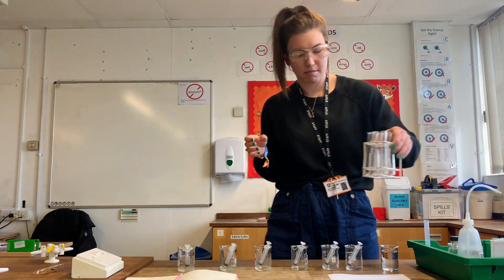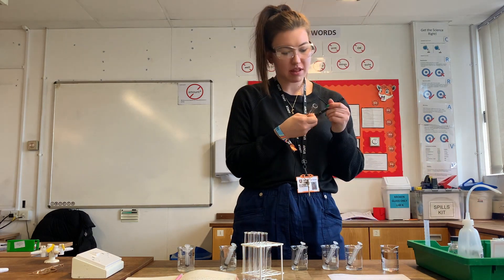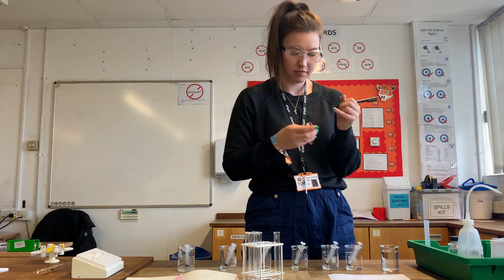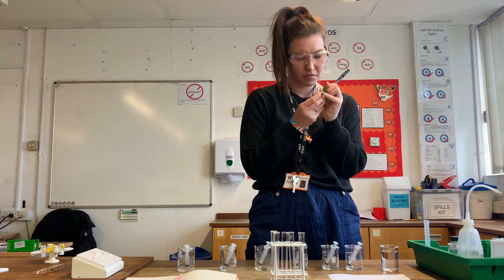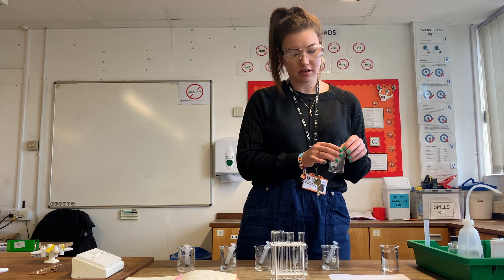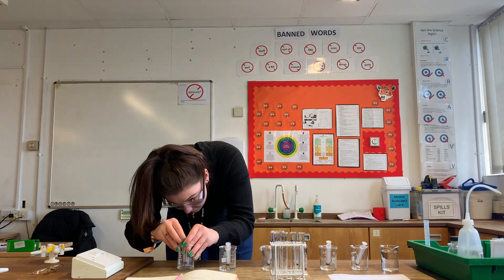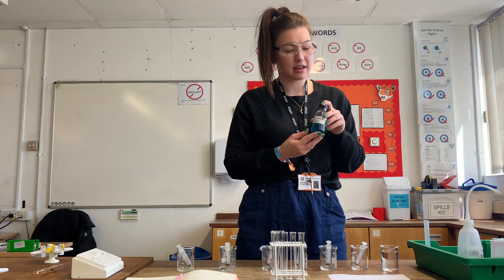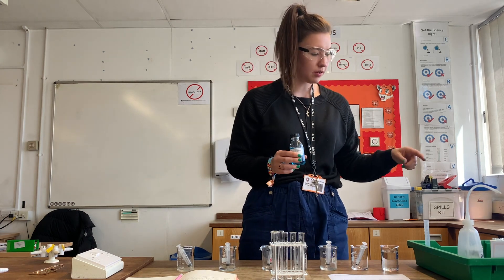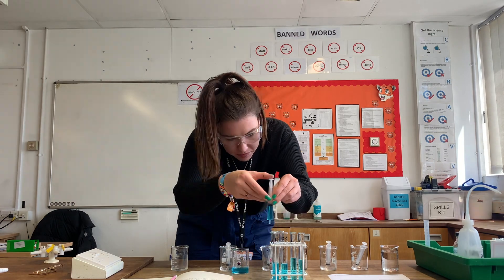Next I have to label my test tubes - the instructions say boiling tubes but we have test tubes. I need to label them with each of the concentrations we've just made, and one of them needs to be labeled with 'unknown'. I then need to take one centimeter cubed of each of my glucose concentrations and pop them into the corresponding tube.